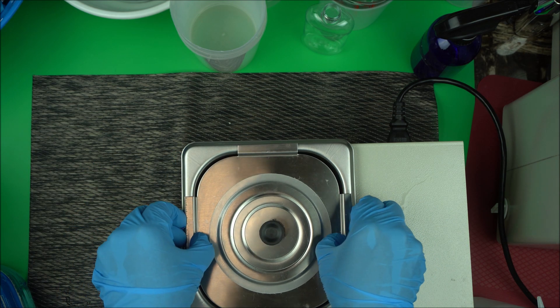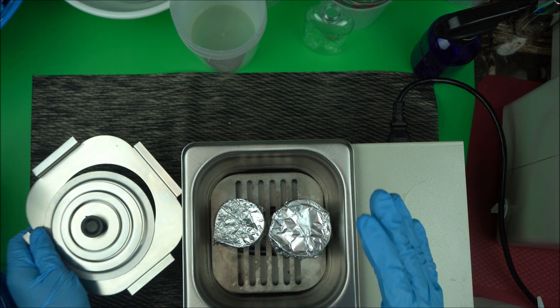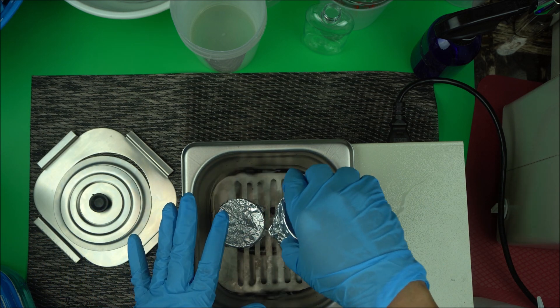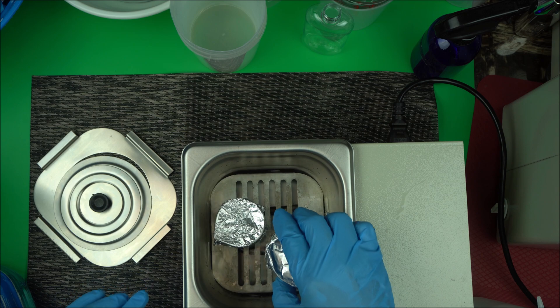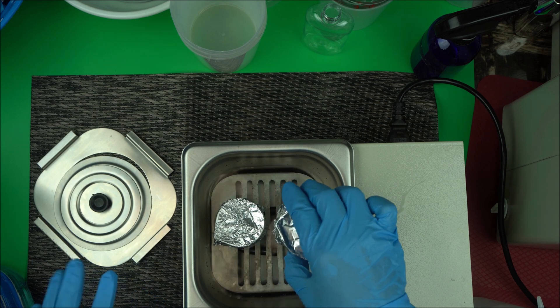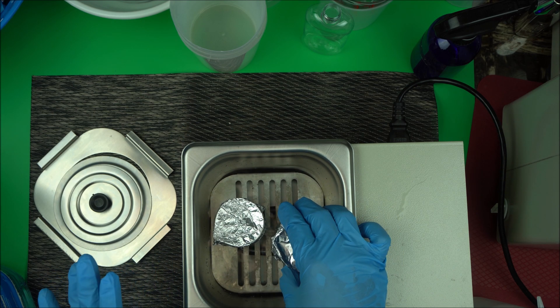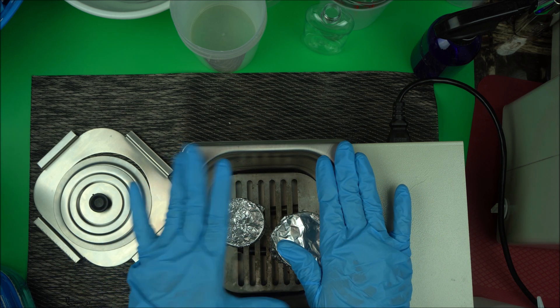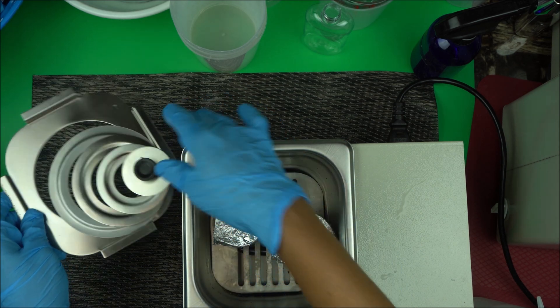This water bath needs a beaker of at least 100ml. A beaker up to 250ml will do also. You put your beakers in then you cover it.